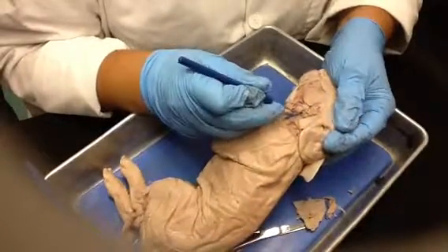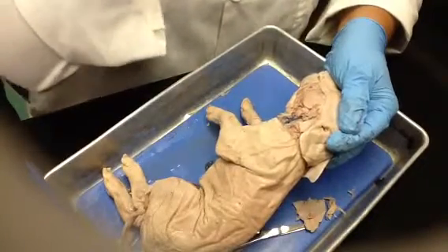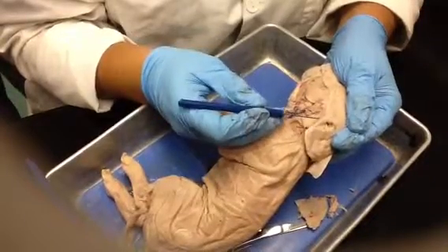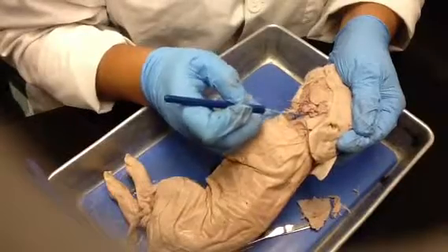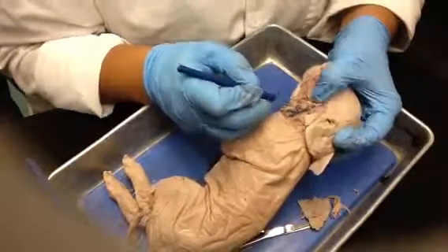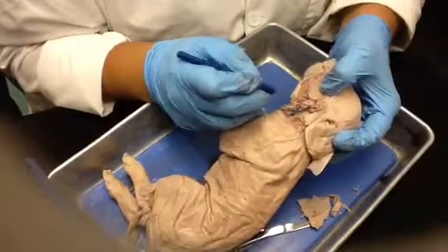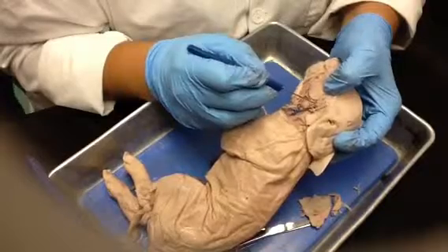As I was telling them, the parotid gland in humans sits right on top of the masseter, right before the ear. But notice that there's a bigger separation between their ear and their jaw, right? So they're going to have the parotid gland in this area. Remember that for glands, what you're looking for is that chunky structure. This one's a little bit more organized, but this one's a little chunkier. So you can see that.